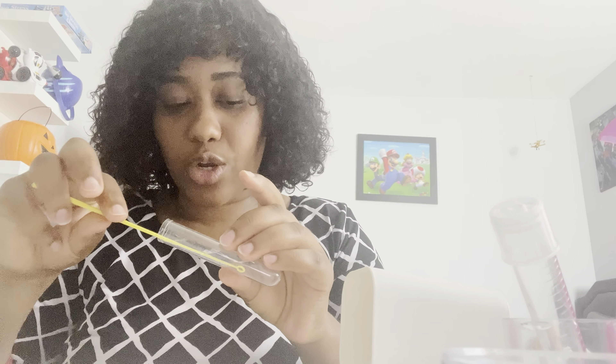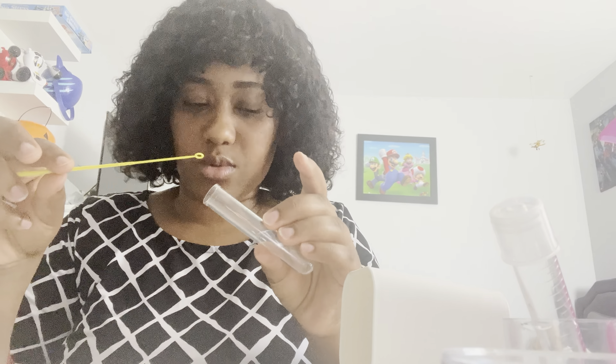Holding the glass part, I pick up the test tube and using my pinky finger I take off the top. Then I sterilize the opening at the micro incinerator for two to three seconds. I take my already sterilized inoculating loop, mix up the bacteria to make sure it's mixed nicely, then go in with the loop and pick up just a bit of bacteria. Then I sterilize the opening again, snap the cap back on, and place the test tube back.